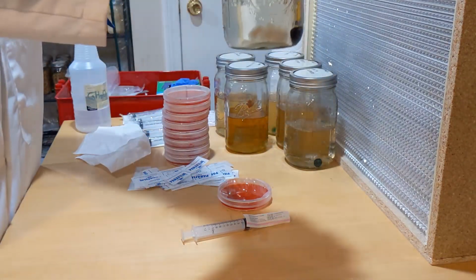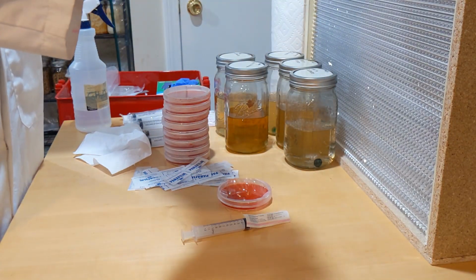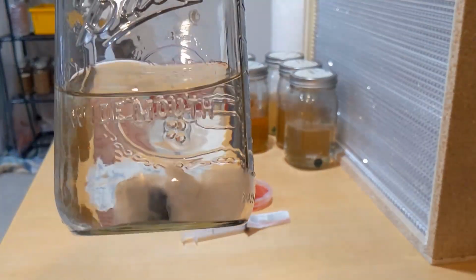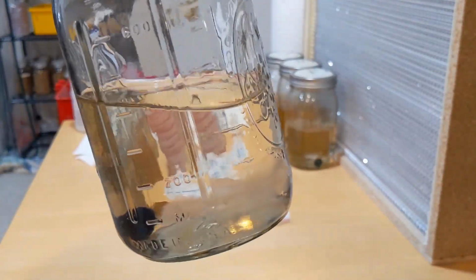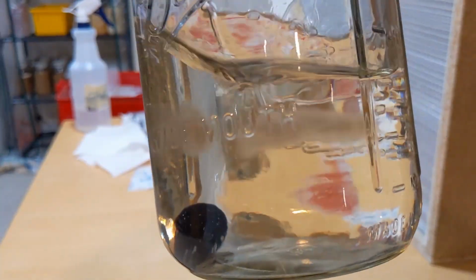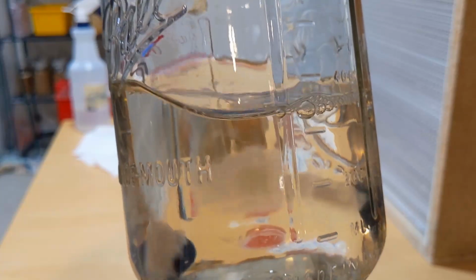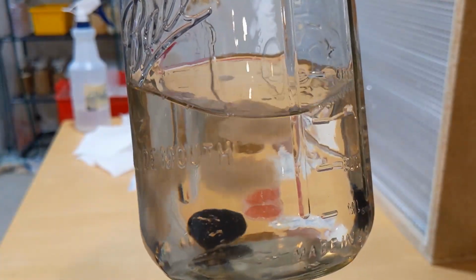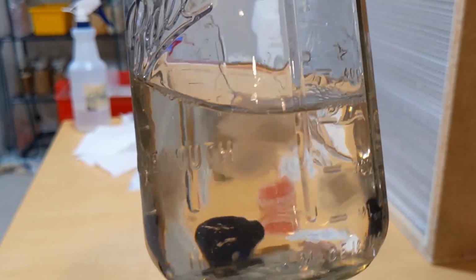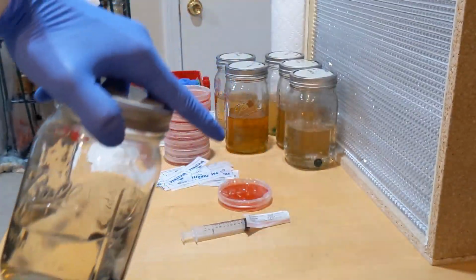Now, let's see, they kind of fuzzed up and it's fuzzy. And then we've got little particles kind of floating around. So we're going to try to capture some of that and drop it on the agar. That's right there.